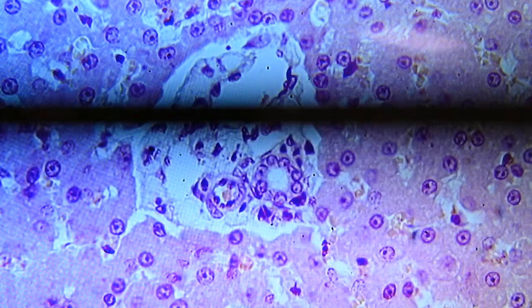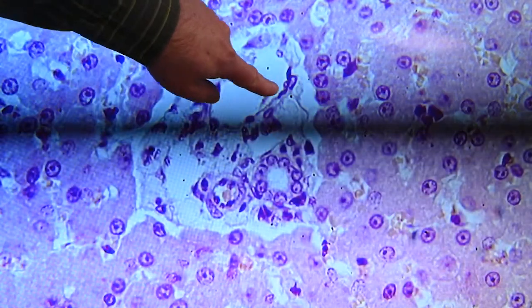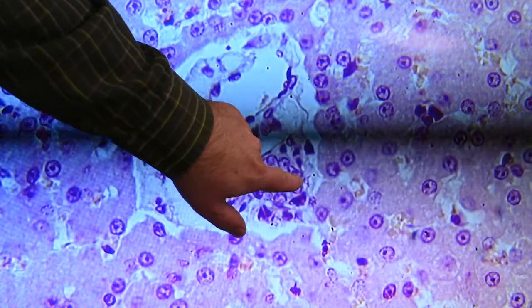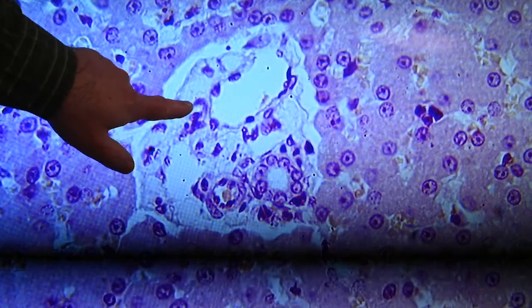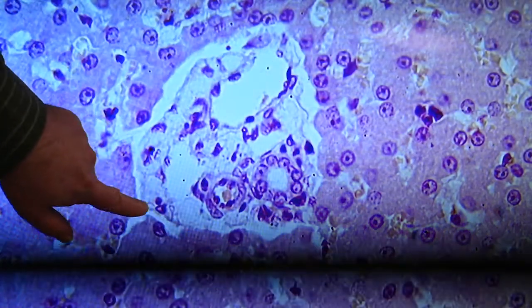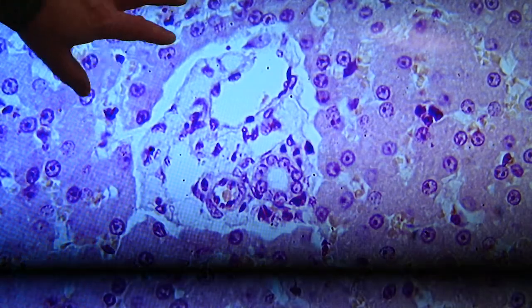A small portal triad example. This is our arteriole right here, small artery right there, a branch of the hepatic artery. This is a part of the hepatic portal vein. This could also be part of the hepatic portal vein branch right here, so we have a couple of those. And we have a nice ring of cuboidal cells making up the bile duct portion. There's not a lot of collagen and connective tissue around that, but a little bit. So we can see a very definite region for the portal triad, and everything outside of that is hepatocytes and sinusoids and associated tissues.